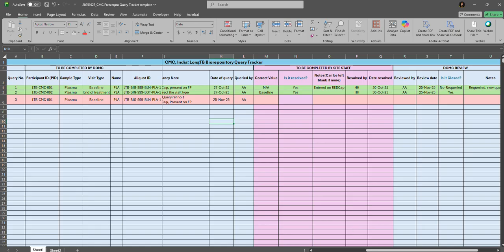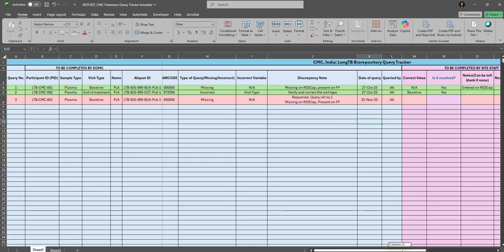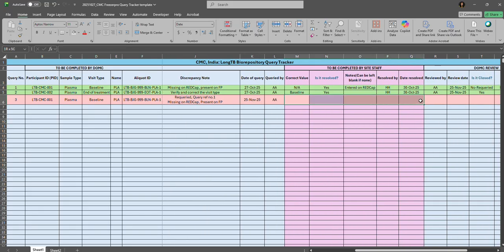So this way, the site staff will always find the new queries at the bottom of the query log here, and they should always refer to the ones that are highlighted in red to respond to the queries. The DOMC staff will update the query logs and share it with the sites bi-weekly. The sites must respond to all the open queries within 1 week of the query date. Thank you.